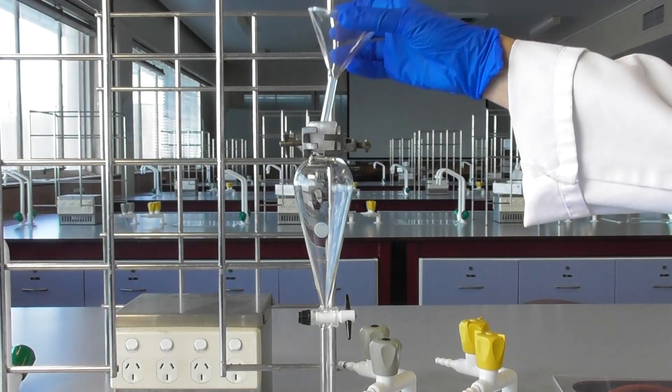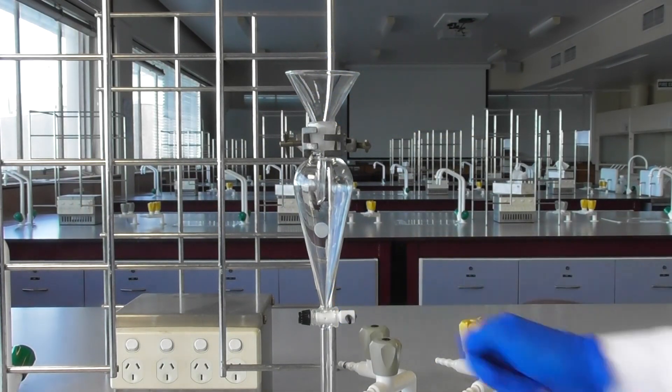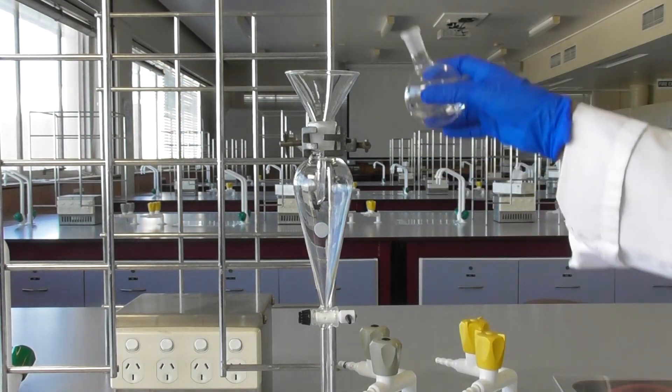Set up a separating funnel. After ensuring the tap is closed, add your reaction mixture using a funnel.